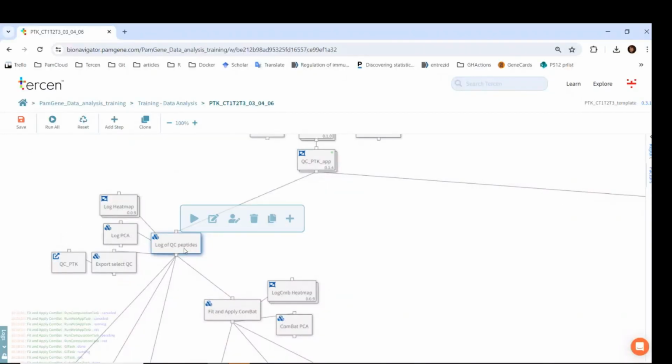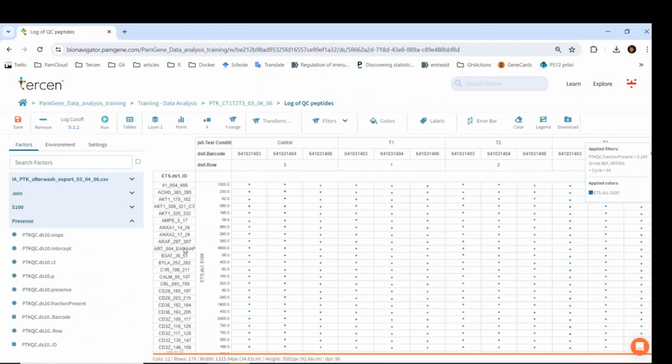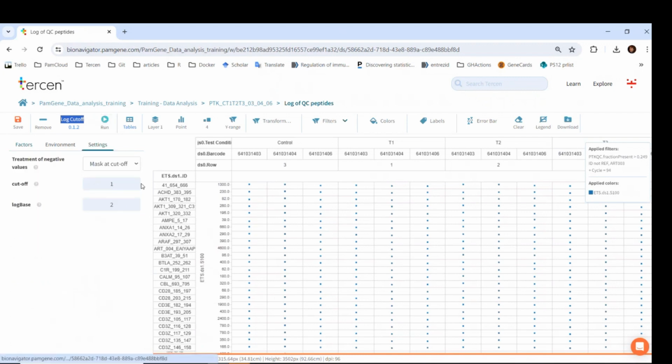Let's look at the log step. The operator is called log cutoff because in addition to the log transformation, it also handles the negative result values that come from values between 0 and 1. If we go to the Settings tab, we can see the parameters of this operator. The treatment of negative values is set to mask at cutoff, and the cutoff is set to 1.